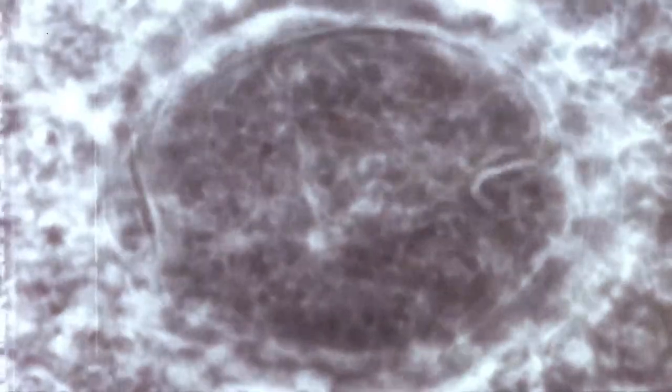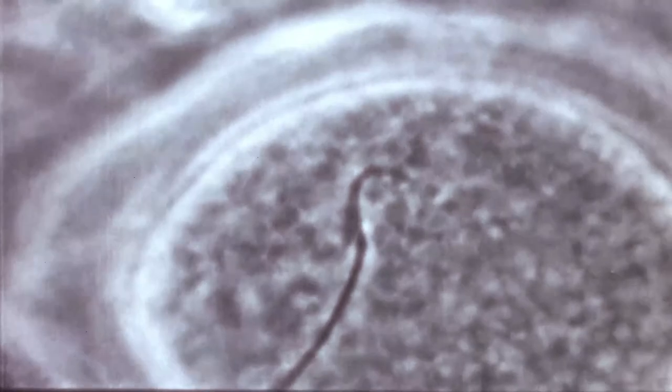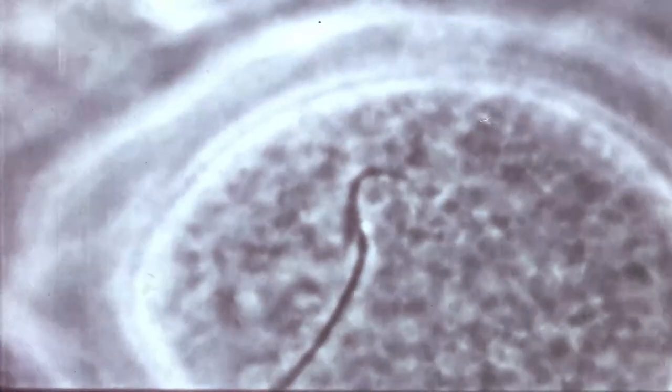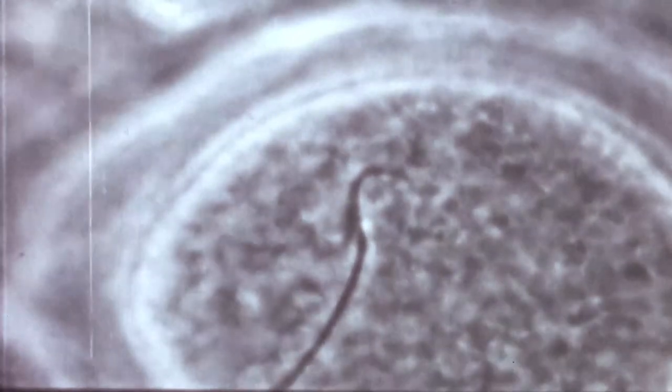Sperm may be observed within the perivitelline space of an egg without a noticeable change in the granulosa cell mass. Several spermatozoa may penetrate into the perivitelline space, but only one enters the ooplasm to effect fertilization. In this specimen, the fertilizing sperm has become quiescent, but the accessory spermatozoan is actively moving about in the perivitelline space. After a sperm penetrates into the ooplasm, it soon becomes quiescent and its head, which contains the nuclear material, is transformed into the male pronucleus.